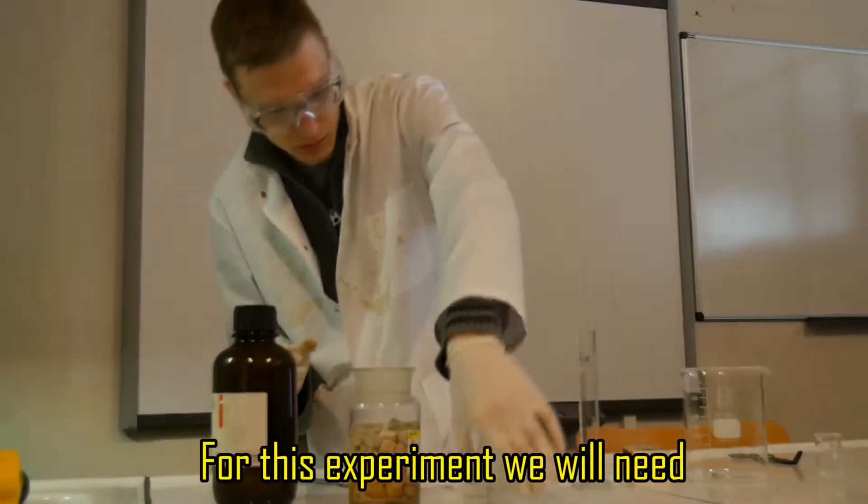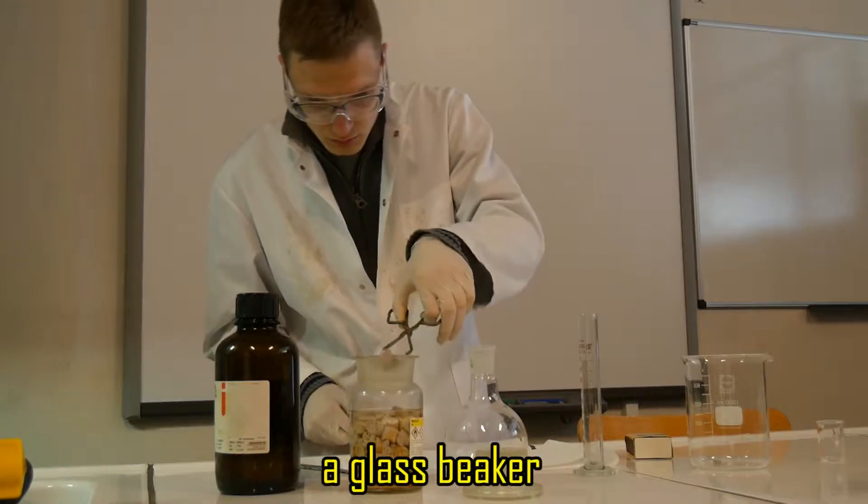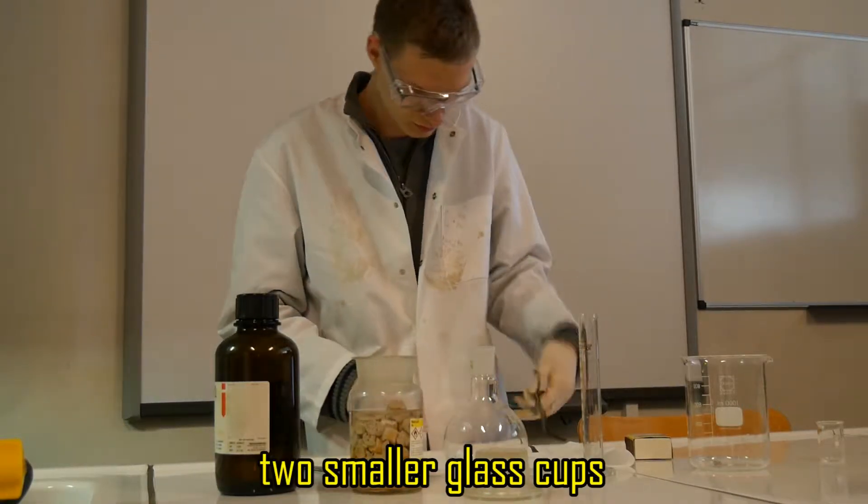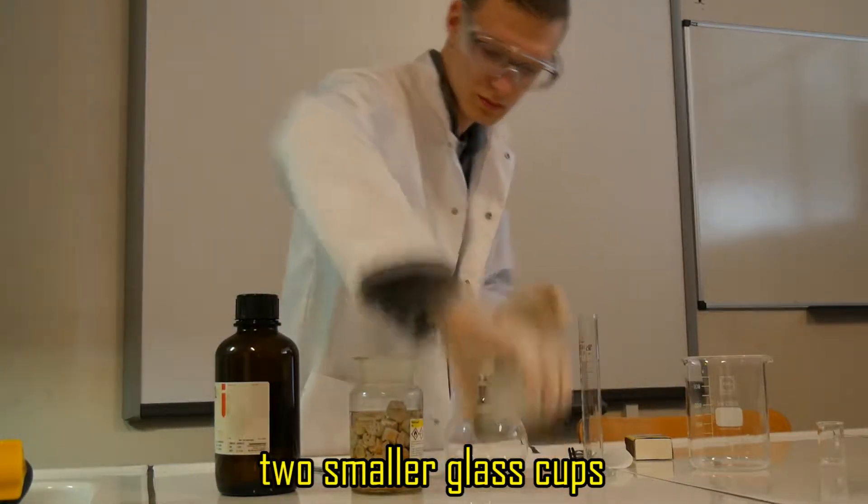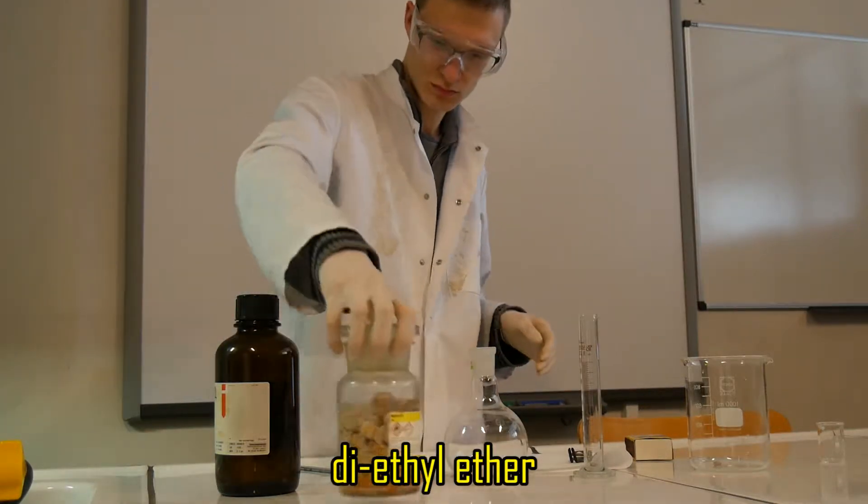For this experiment we will need two pipettes, a glass beaker, two smaller glass cups, sodium, diethyl ether, and water.